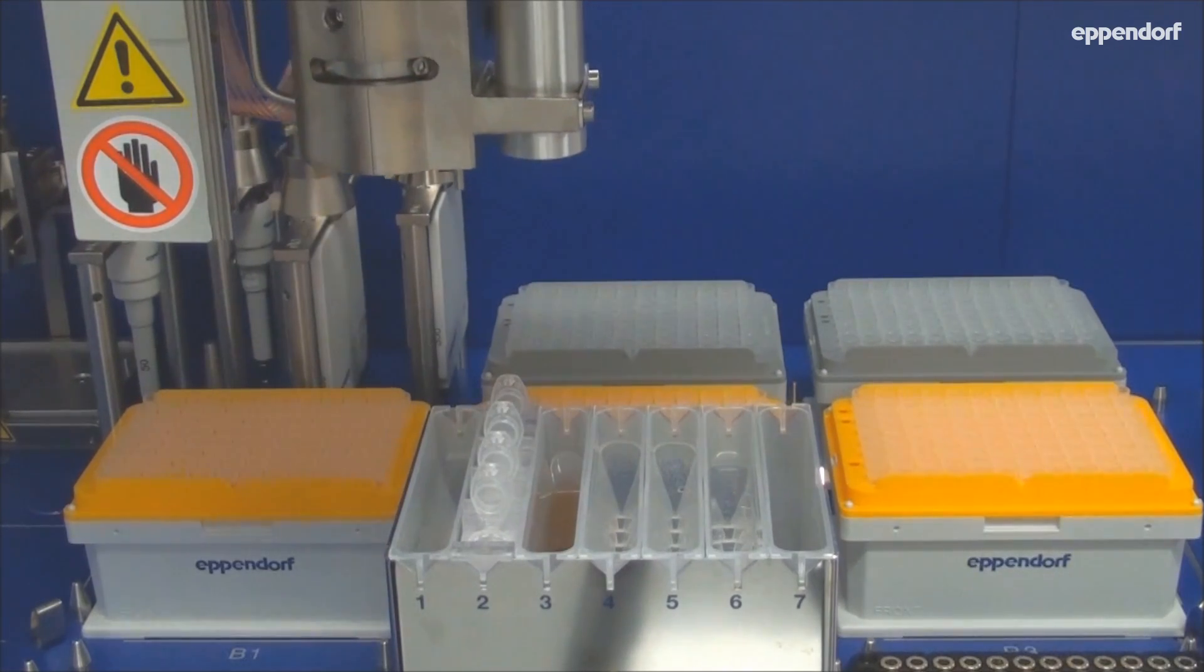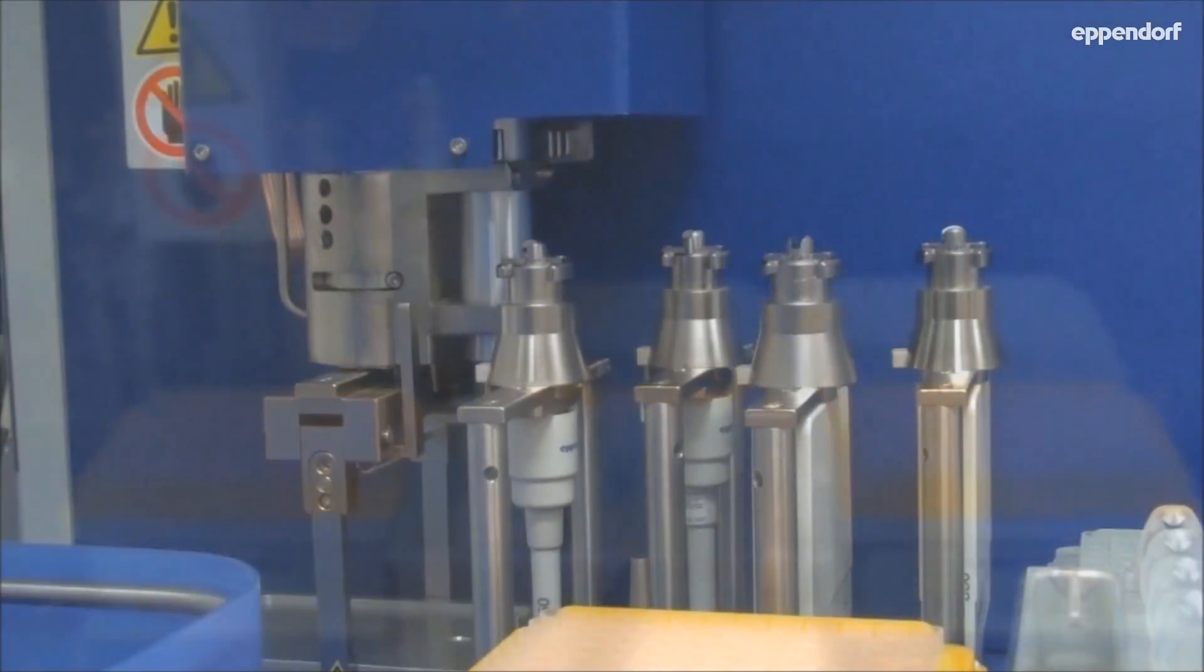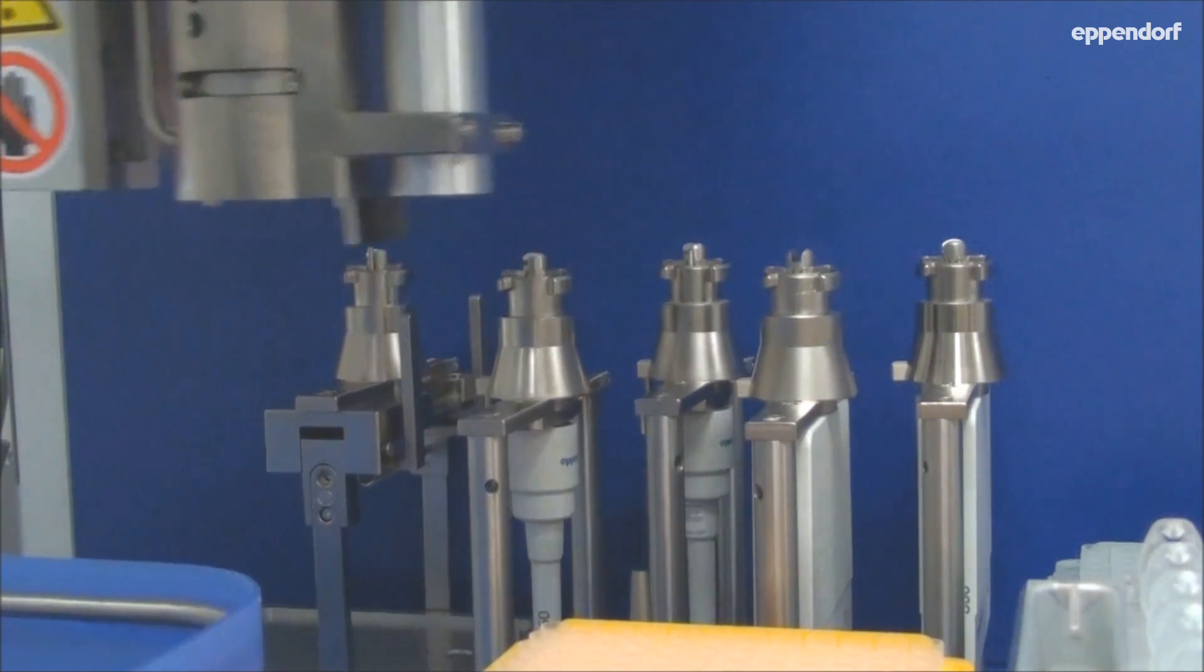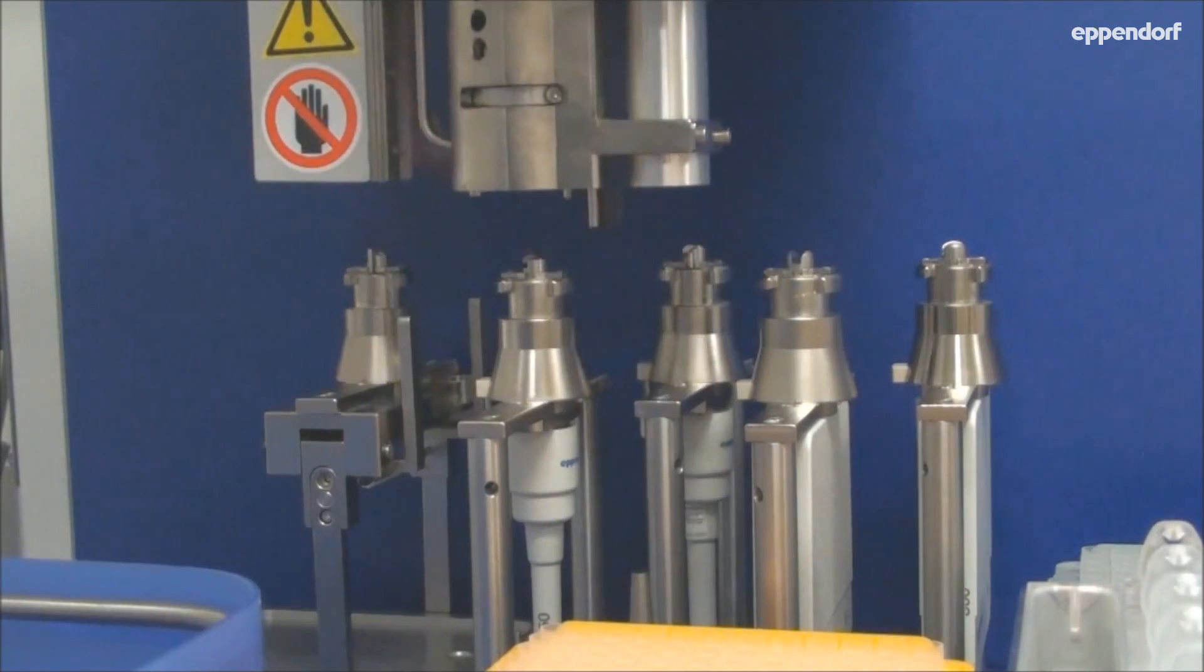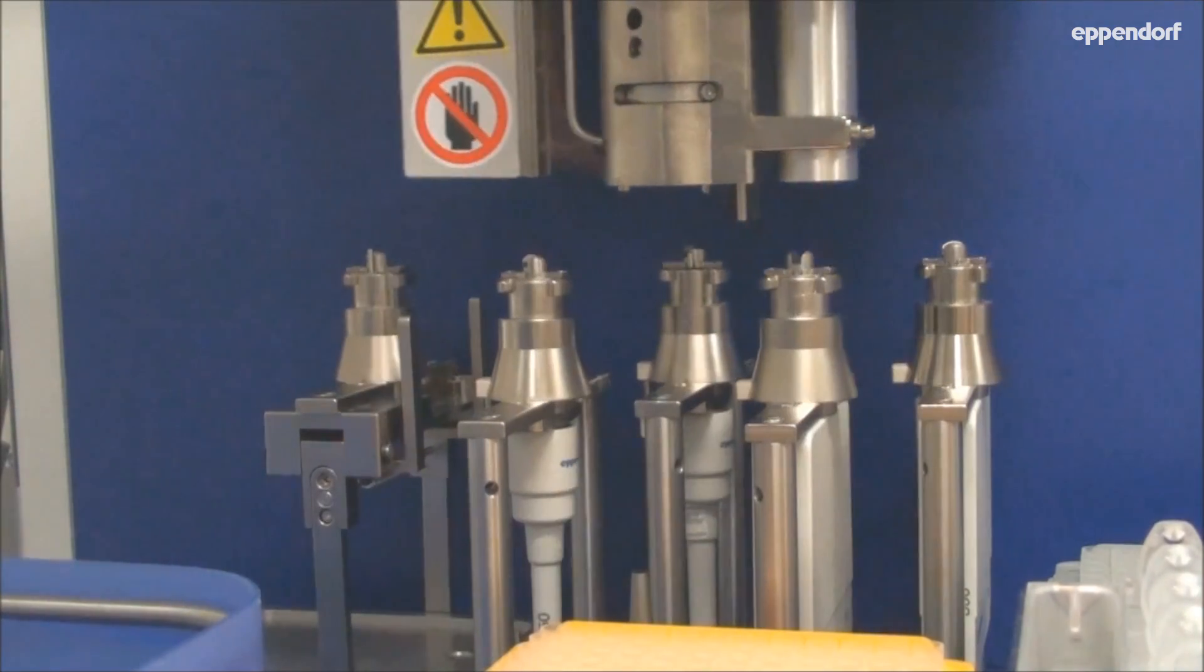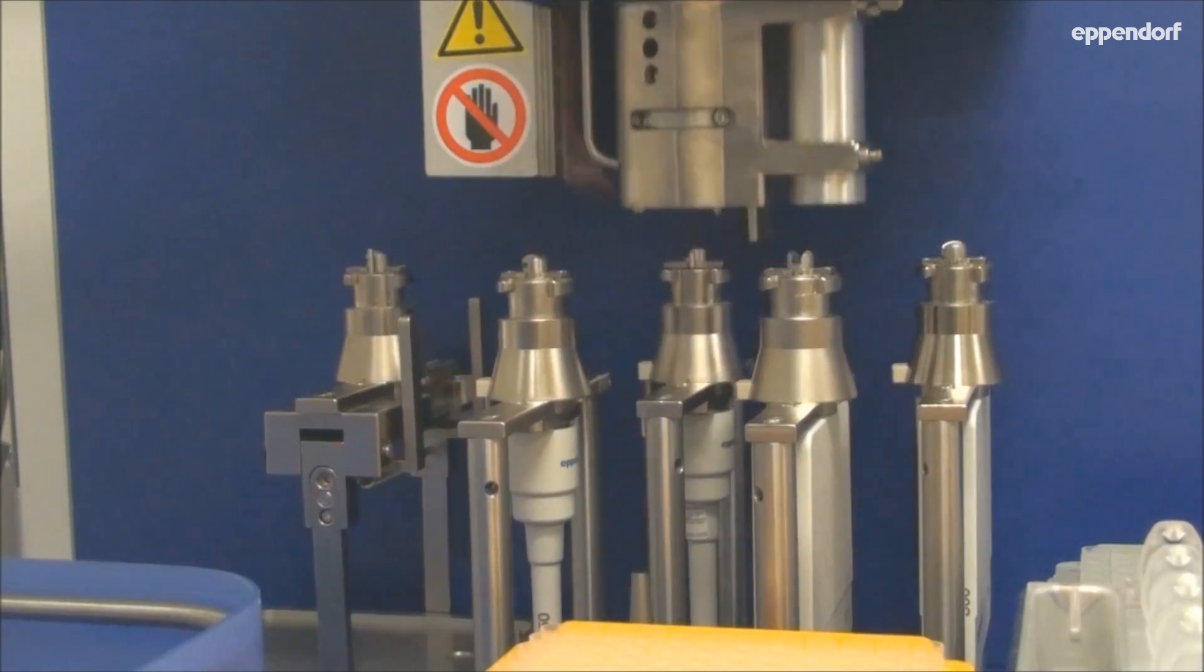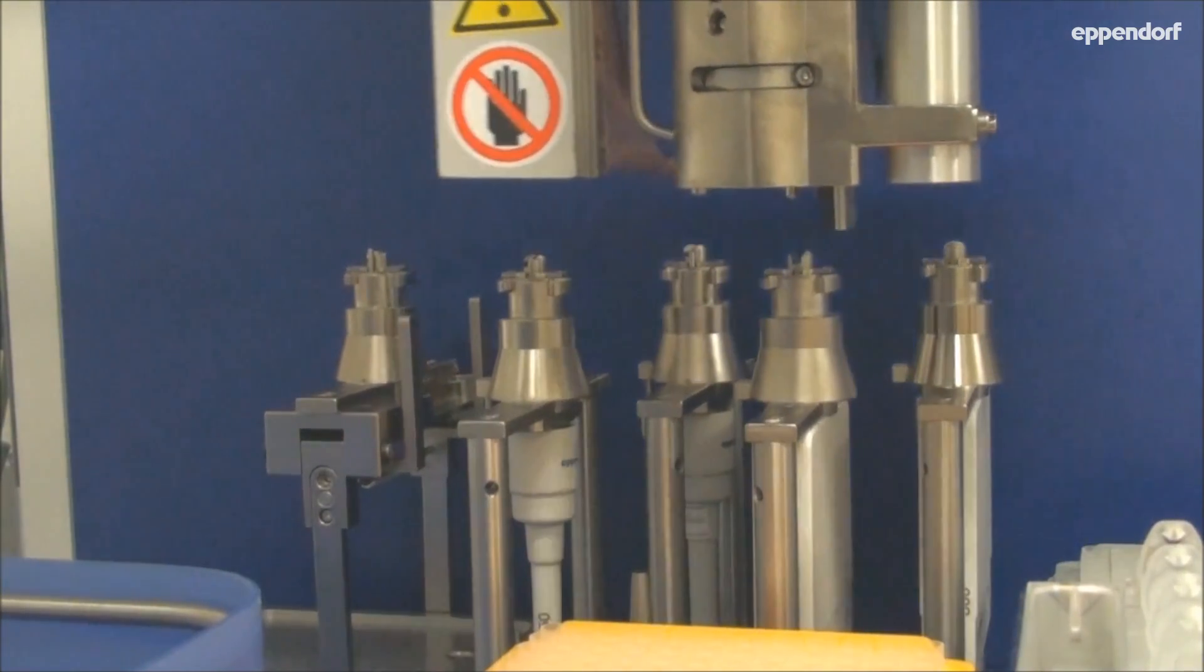During the initialization process, the system will inspect the protocol for errors and scan the deck. The scan will determine the starting volume of reagents on the deck, as well as ensure the correct labware is positioned properly. When the scan is completed, you can be confident the protocol will proceed successfully.